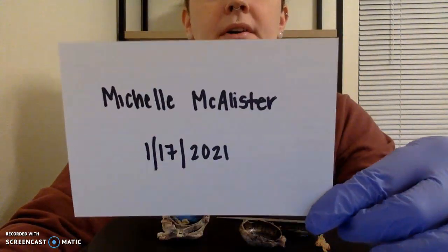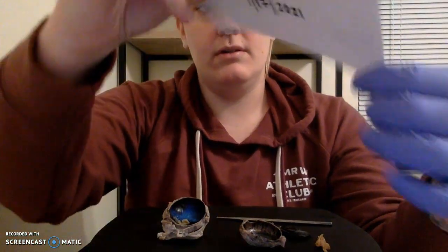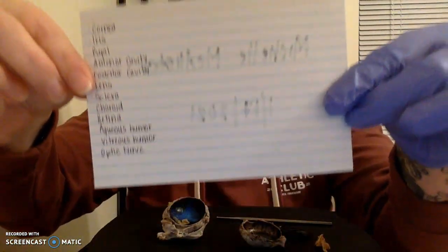Here is my card. And today we are going to be looking at a dissection of a cow's eye. So here is the list of features that we are going to use.